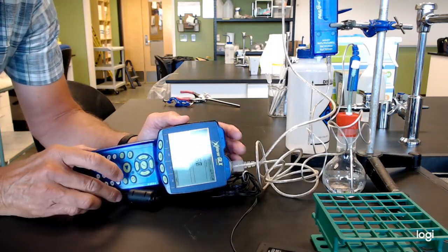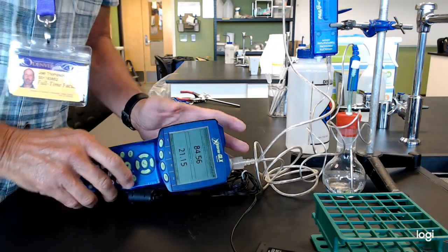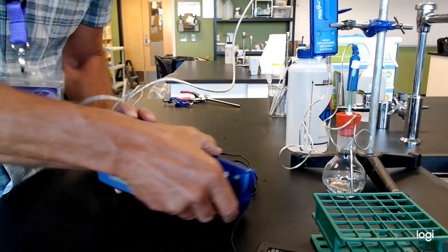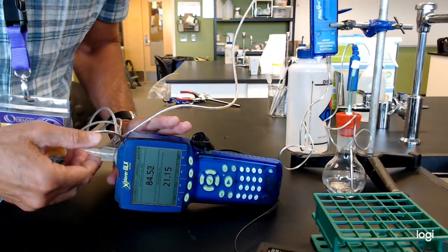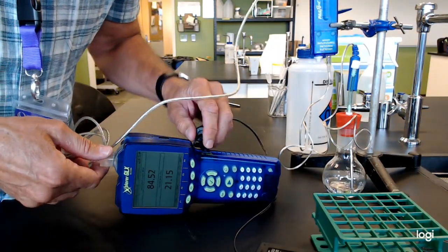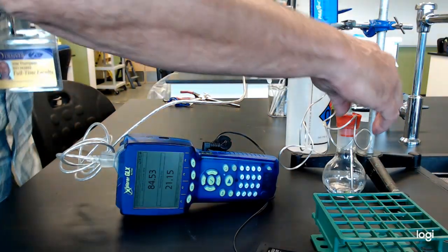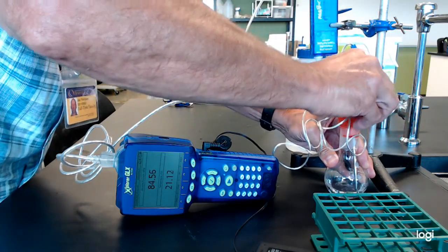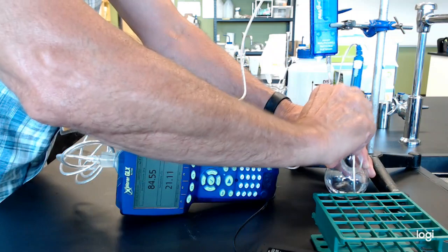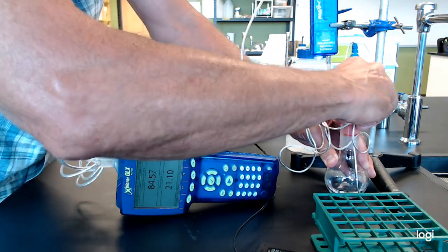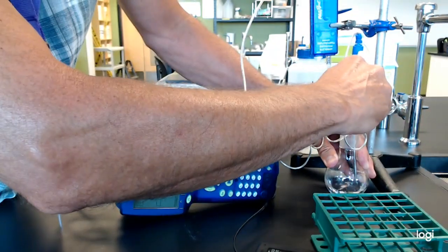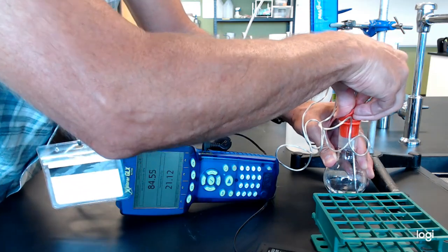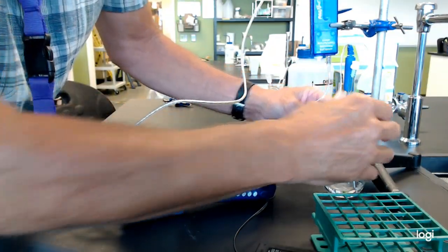One of the good tests I have is if you can get this thing to behave for a second. I can look at this septa and I'm already questioning its integrity as far as whether it's just old and needs to be thrown away. But if it's good, I'm going to pull this out. When I put this septa in, it should increase the pressure. And if it's got a good seal, that will actually hold for a minute.